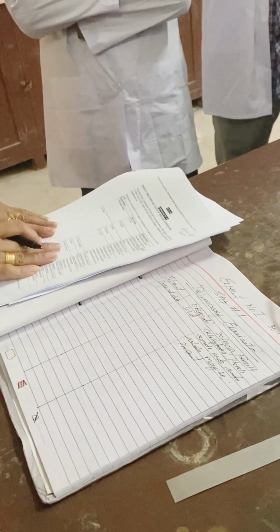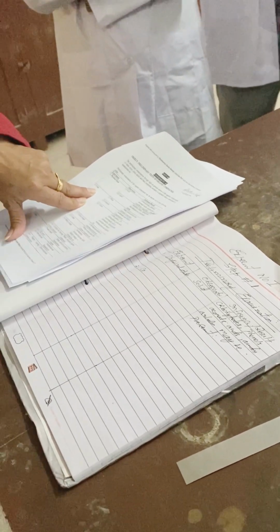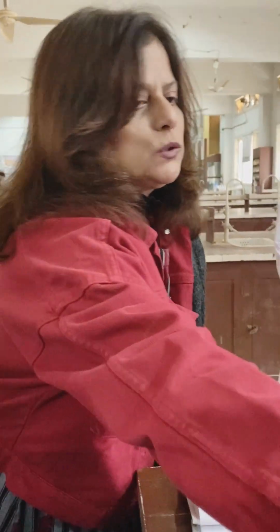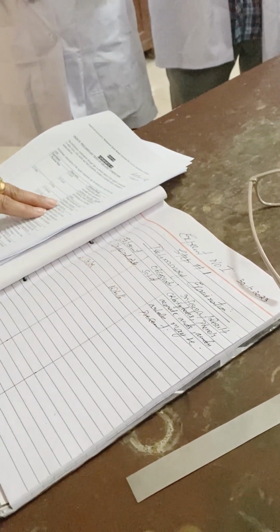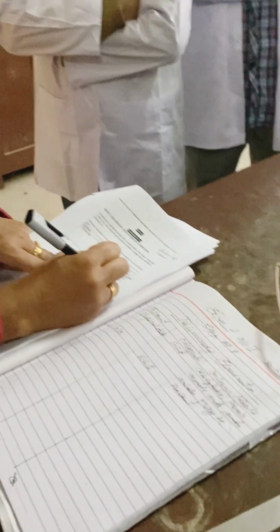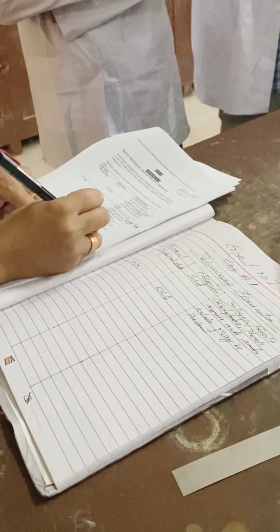In this same way, you're going to write down number two. You'll jump to the second step, which is the color. C-O-L-O-R, color. Now we know it's white in color, so you simply write down white. Now which categories of compounds it comes under, you will write down everything and add it over here, may be present. Here also, with every result you have to write down "may be present".